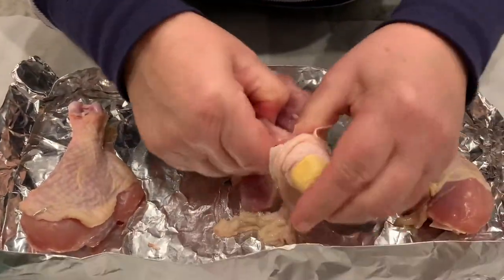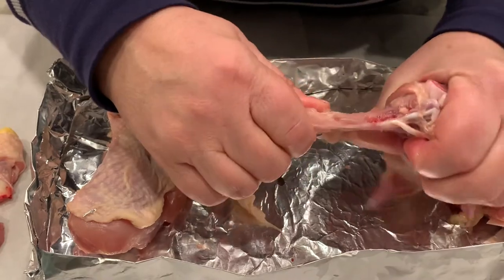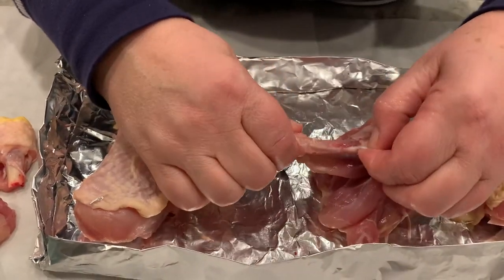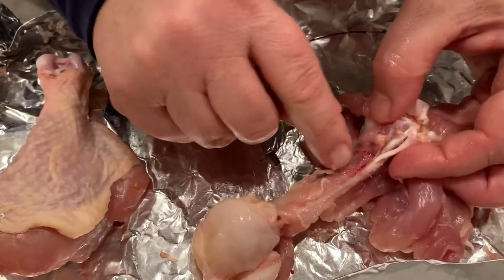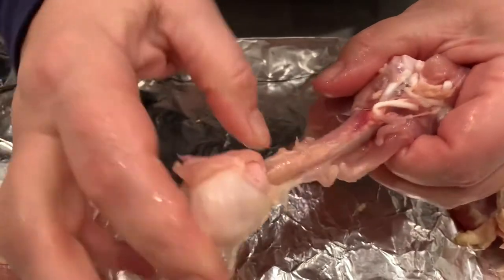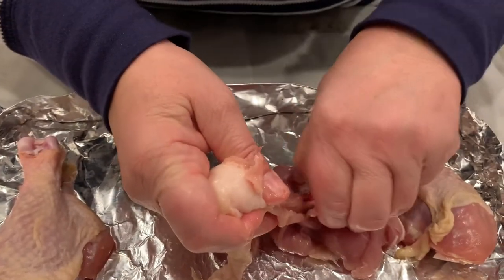The fibula is a small bone that runs along the tibia. You can see how blood vessels actually run in and out of the bone. Inside the bones there is red marrow, and white blood cells are formed there. See that little hole? That is where the blood vessel runs through. I'll break the fibula here so we can see it a bit better — right there, that is a blood vessel running into the bone, with veins and arteries running in and out.